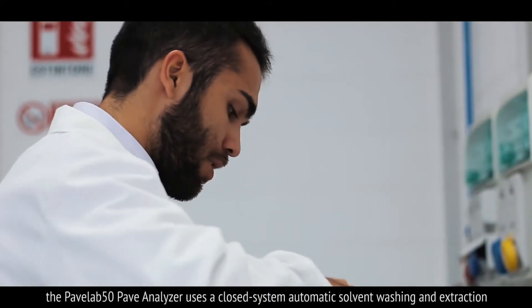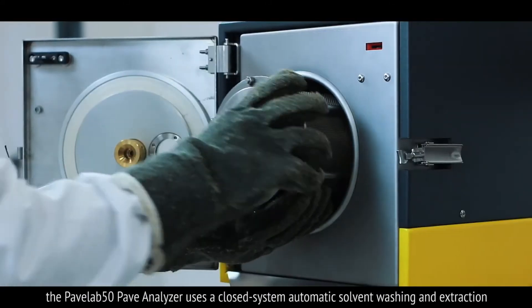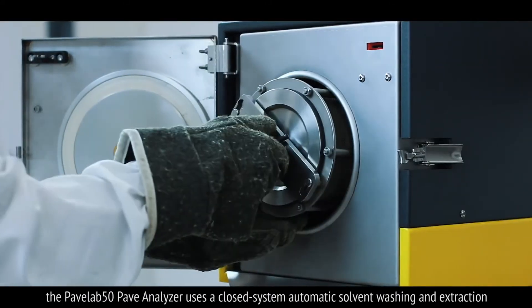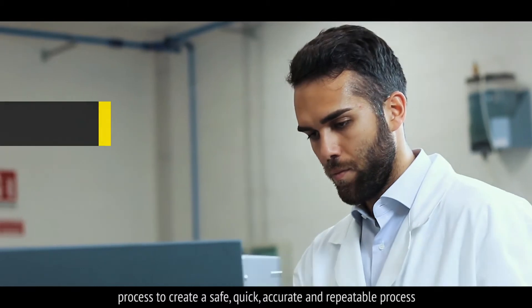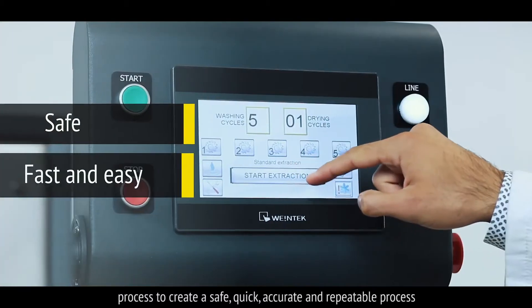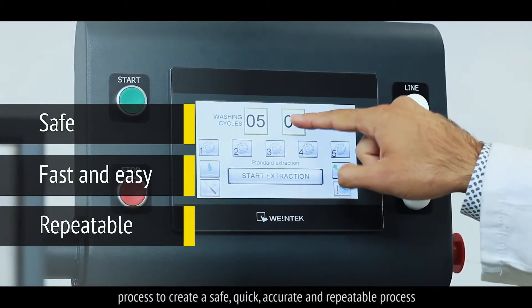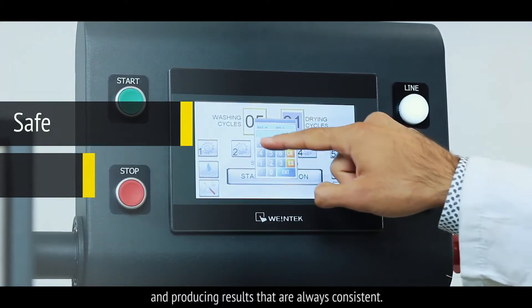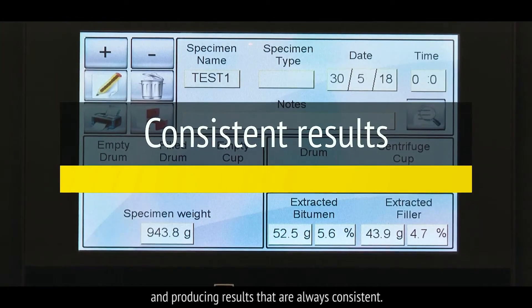The PaveLab 50 Pave Analyzer uses a closed system automatic solvent washing and extraction process to create a safe, quick, accurate and repeatable process, producing results that are always consistent.